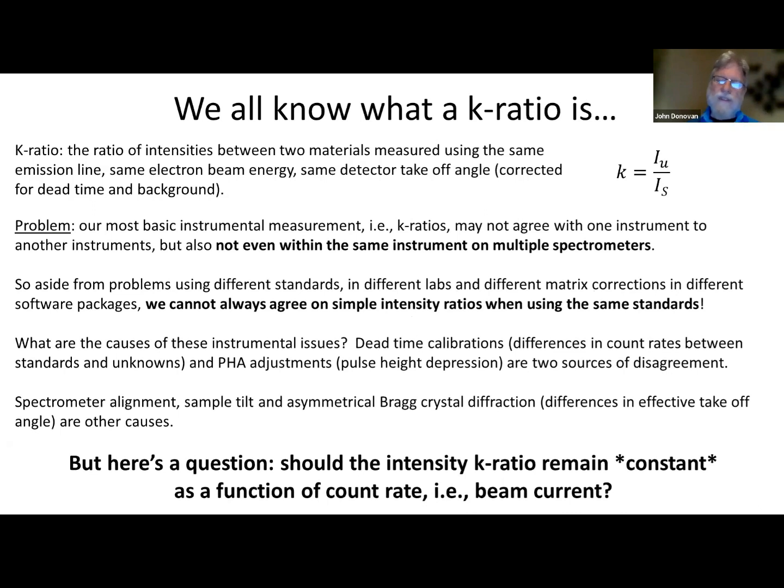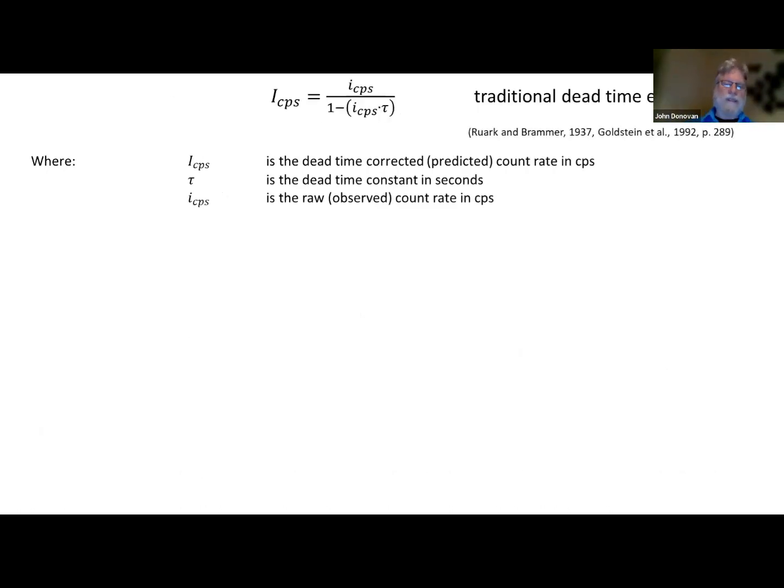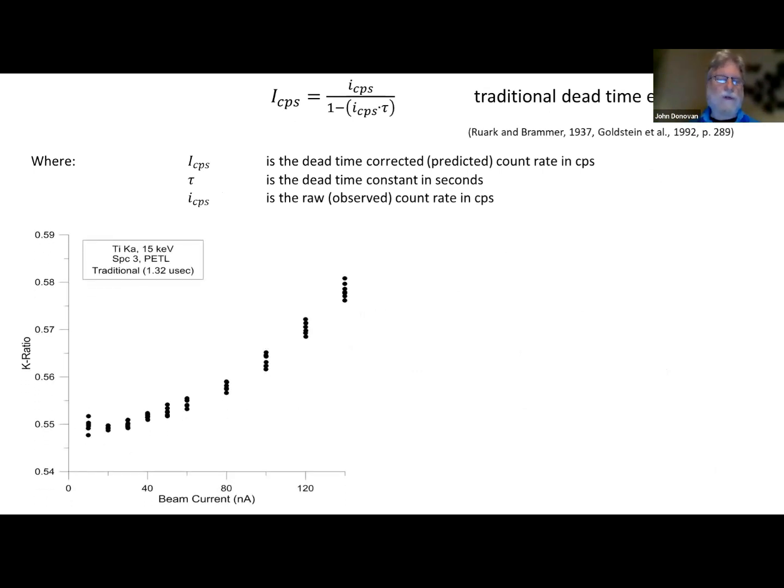But here's the question. Should this intensity K ratio ideally remain constant as a function of count rate, beam current? So in other words, as you increase your count rate, if you remeasure the same two materials, should you get the same ratio of intensities between them? Think about that. Answer the question in your head, and I'm going to tell you what the answer is. Of course you should. Here's the linear dead time expression that we've all used, and most people still use today. And here we plotted K ratio versus beam current. So we're increasing the beam current, which is the count rate on both materials, and we can see that it's pretty constant here. It's not too bad, but around 50,000 counts per second, it starts to go haywire, okay? And modern microprobes with large area crystals can easily produce 400,000 counts a second.